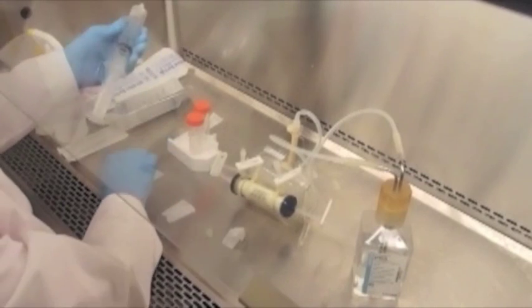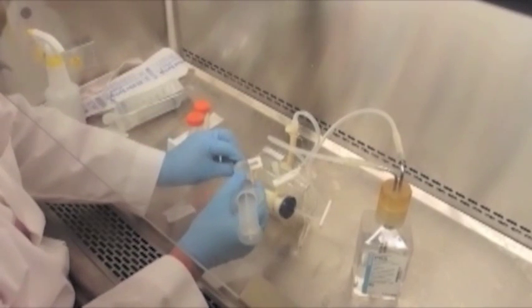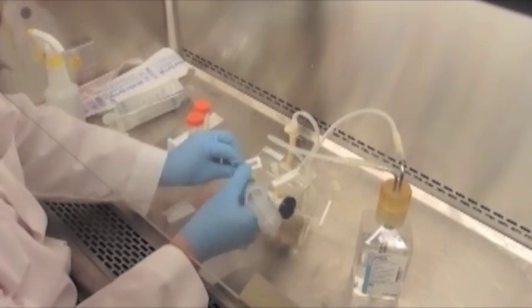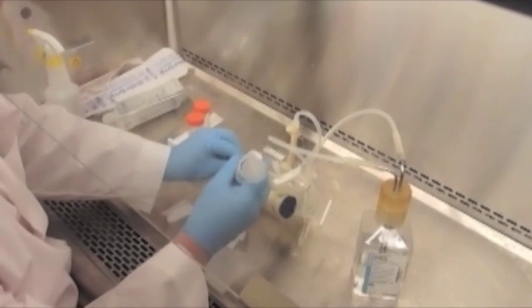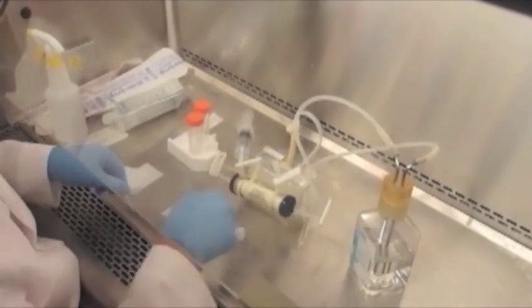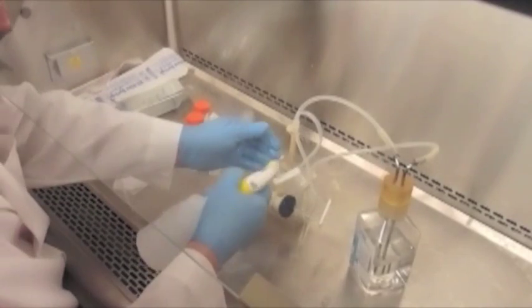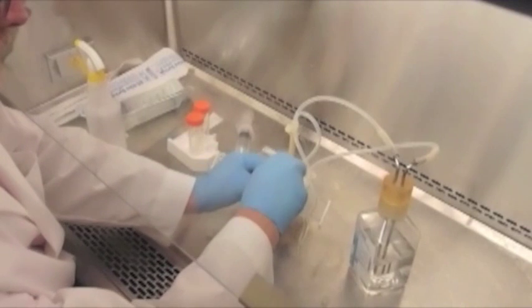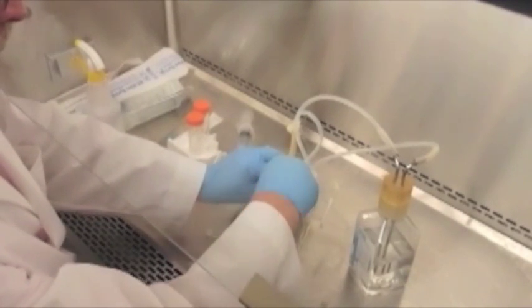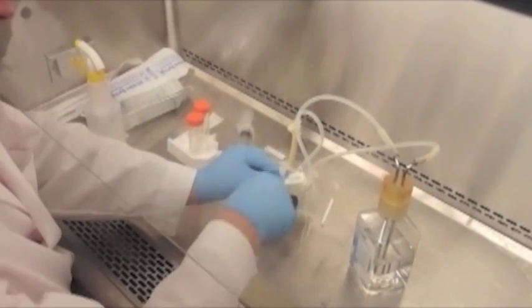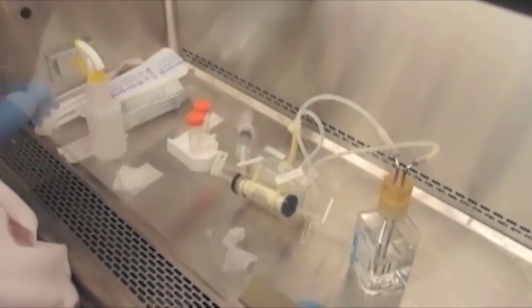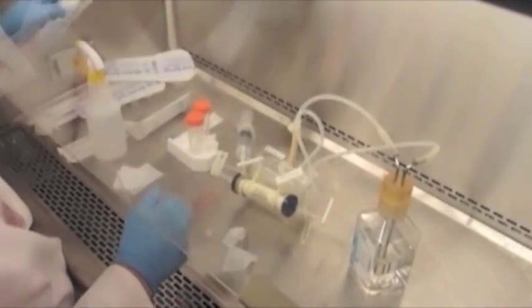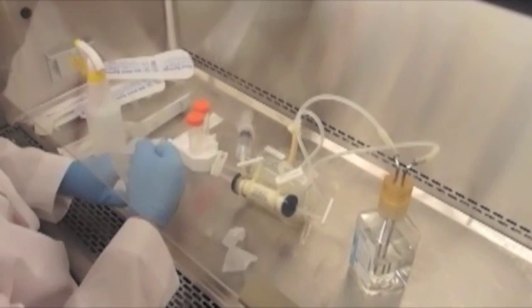Alcohol will not kill yeast spores and bacterial spores. It may be a good idea to get a bleach solution, equal parts bleach and equal parts vinegar, approximately half a cup per gallon. This can also be used to kill spores of yeast and fungi and the like. Although generally, this should not be a problem.